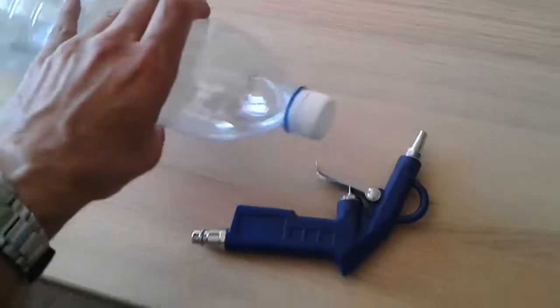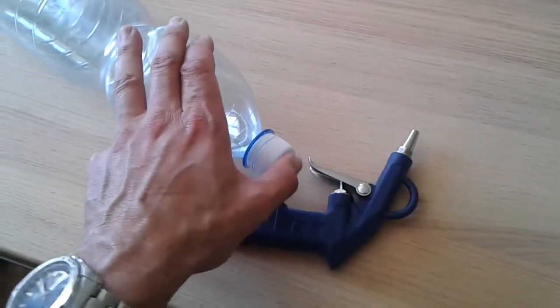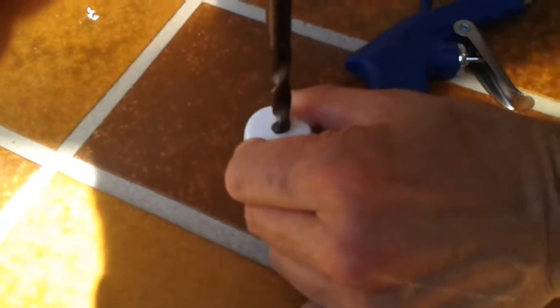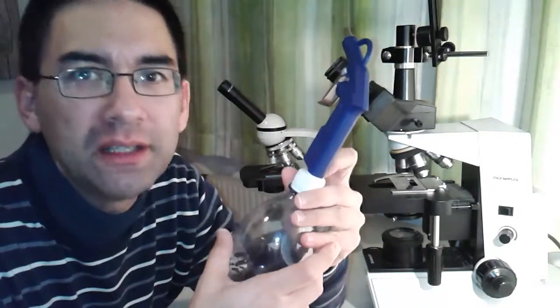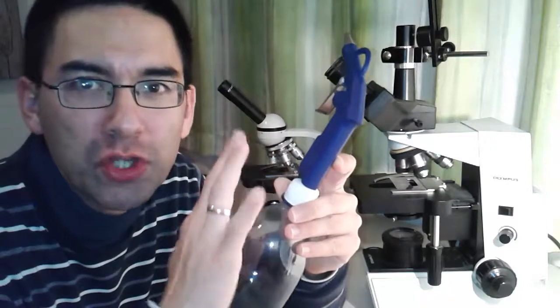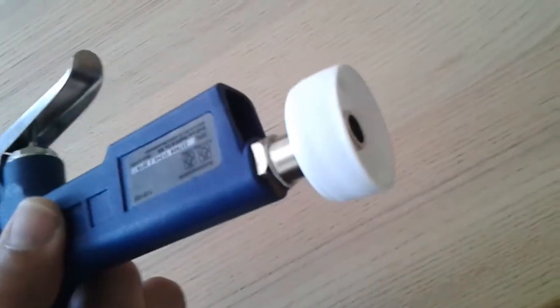So the first thing that we have to do now is make a hole into the cap, and I have to seal the hole tight using a glue gun. And that's what I'm going to do now. I tried to seal this with a glue gun, but this really didn't work. It was not airtight, and also the glue did not really stick very well. It didn't stick at all. So this was a try which I had to completely discard. It didn't work. So I managed to get it through the cap.